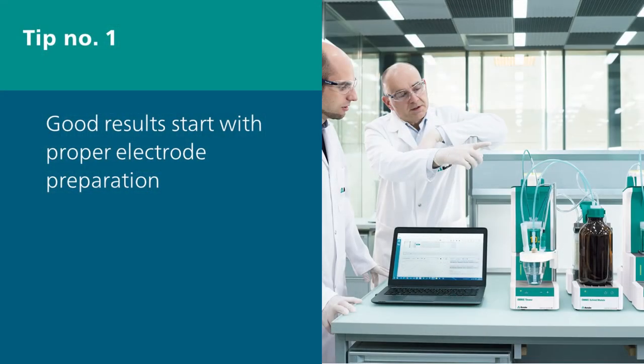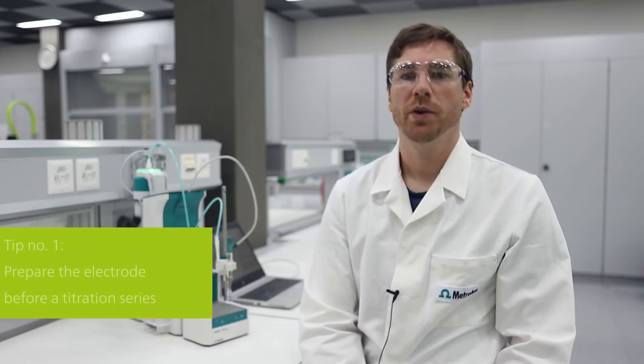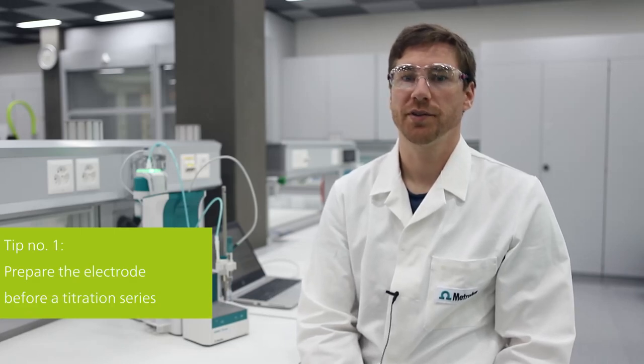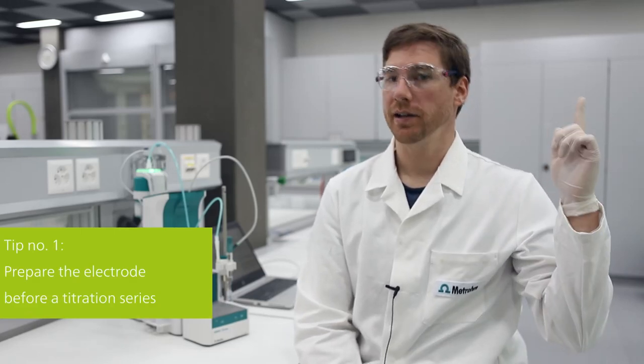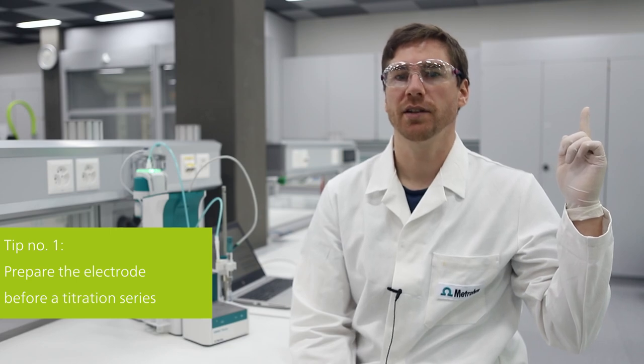Good results start with proper electrode preparation. Always prepare your electrode before the first titration in the morning. Click on this link to watch how this is done step by step.